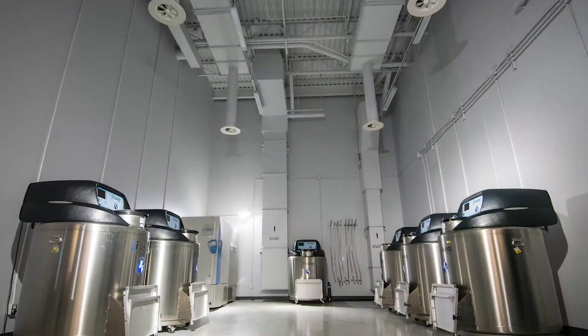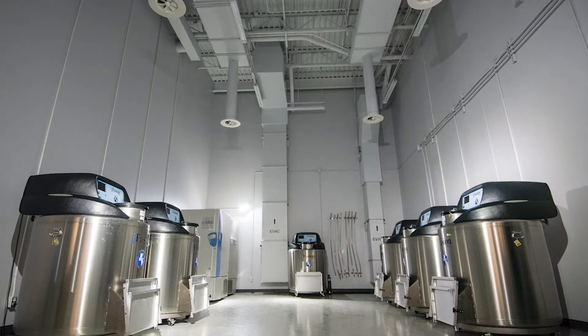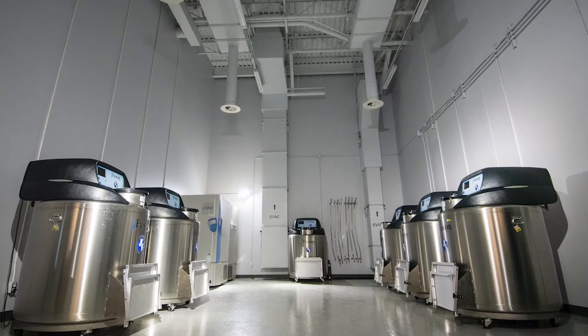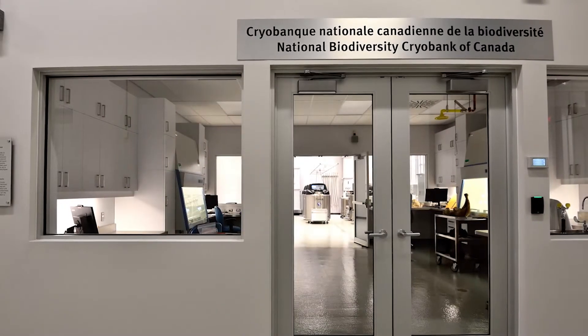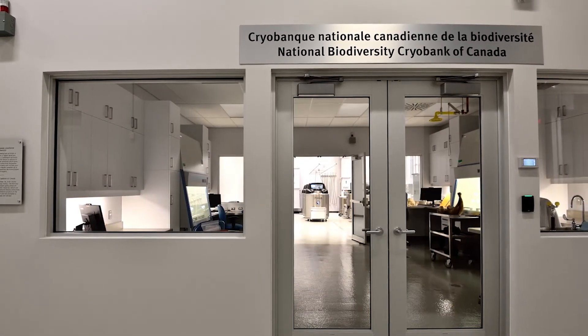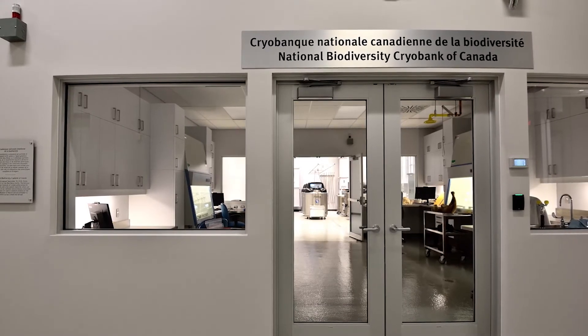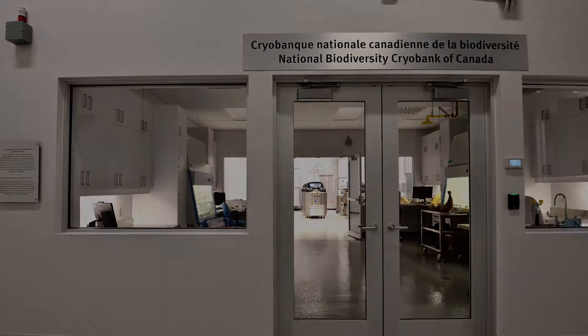Here at the cryobank, researchers from within the museum or around the world can borrow one of our samples to unlock that DNA information. In this way, the cryobank supports biodiversity research that will deepen our understanding of the natural world.